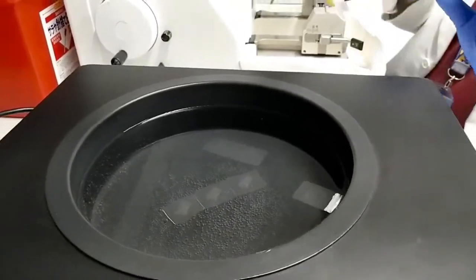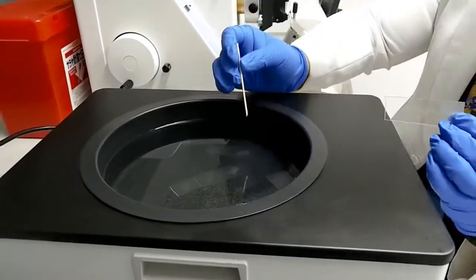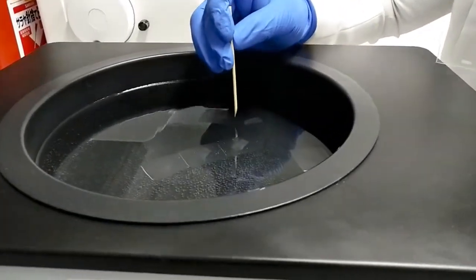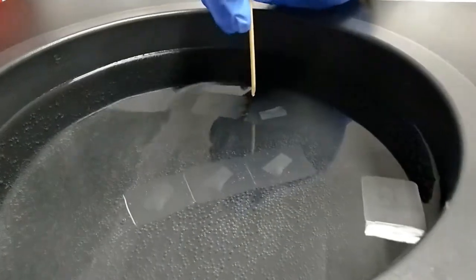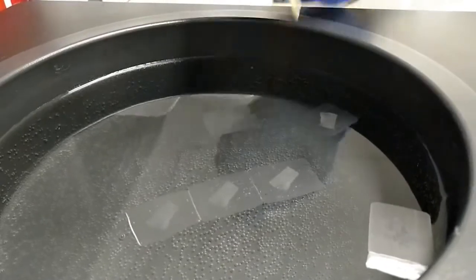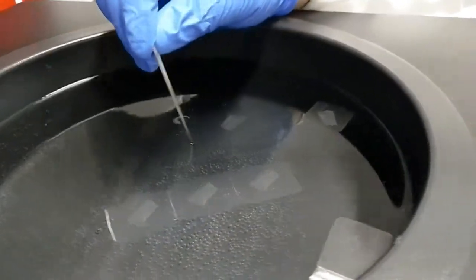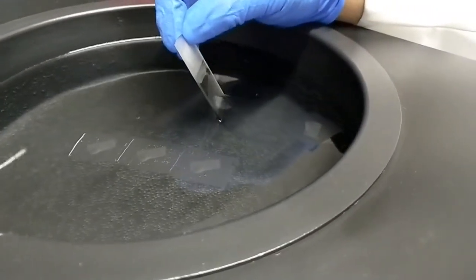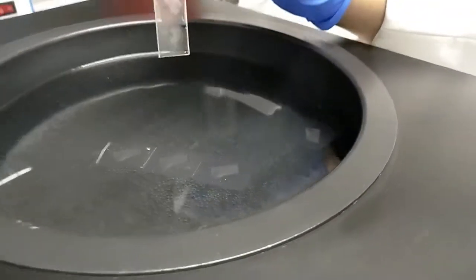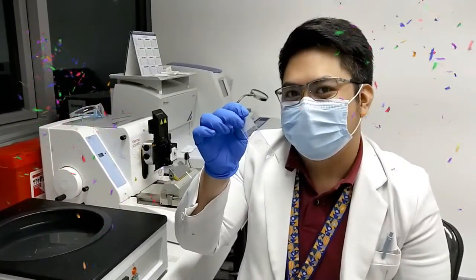Now you can get a slide. Set out your chosen tissue section and then slowly but surely fish out. So now you have your slide ready for staining.